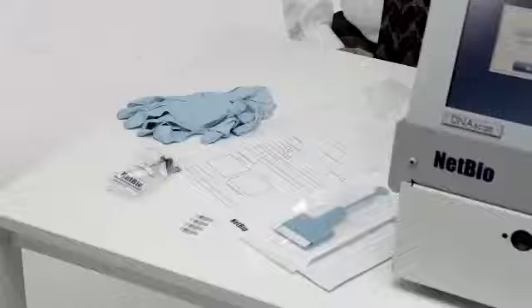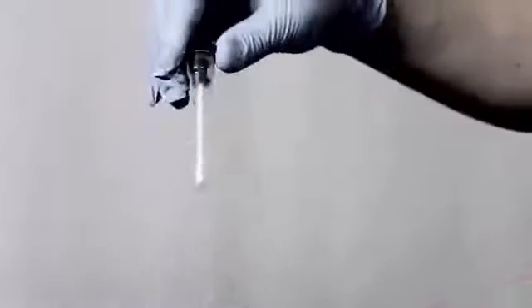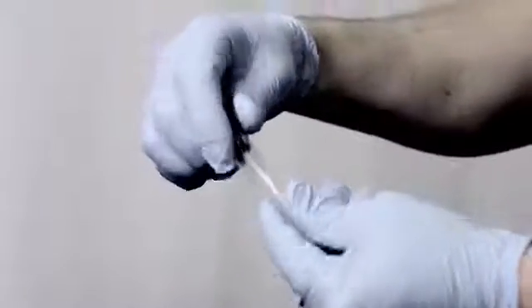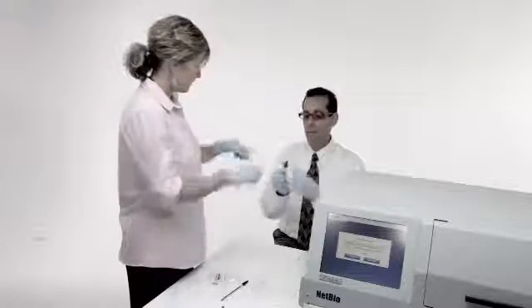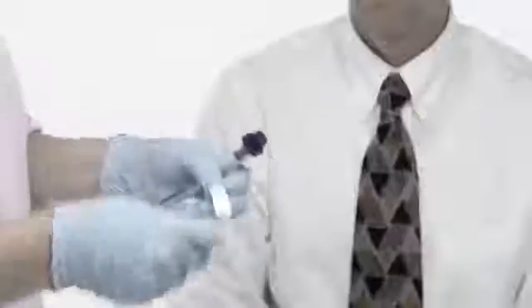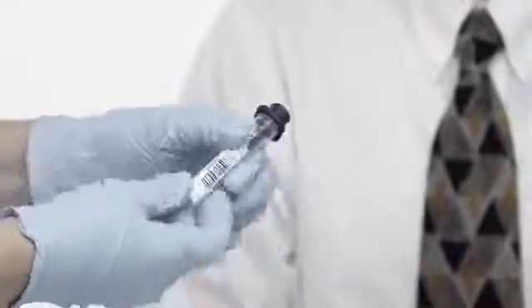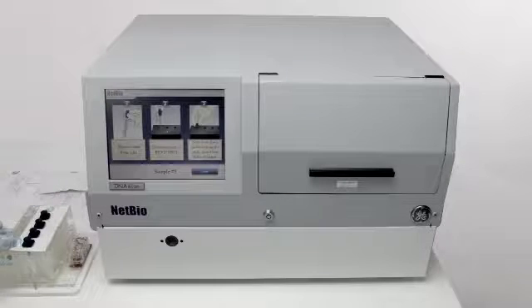Lay out the contents of the kit onto a clean work surface and put on gloves. You may need an additional pair of gloves if the donor collects their own DNA. To collect the sample, select the NetBio Biochip Set swab and remove it from the packaging. Grasp the blue cap of the swab and pull it out of the protective tube. Insert the swab into the donor's mouth and firmly swipe the cotton tip six times up and down on the inside of the cheek. The cheek should protrude slightly during collection. To prevent contamination, avoid touching the shaft or tip of the swab with anything except the donor's mouth. Replace the plastic tube over the swab and place a peelable barcode on the tube. Avoid touching the sides of the tube with the tip of the swab. If less than five samples are to be run, insert blank swabs in the remaining sample chambers.